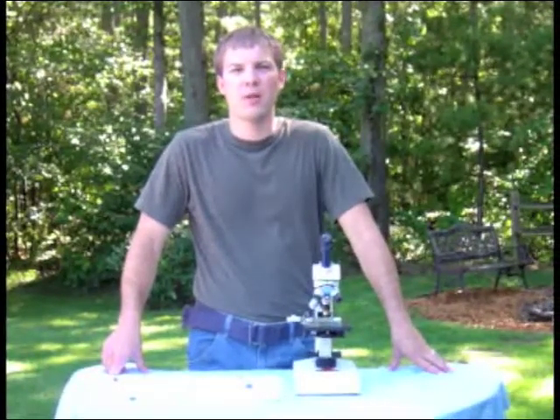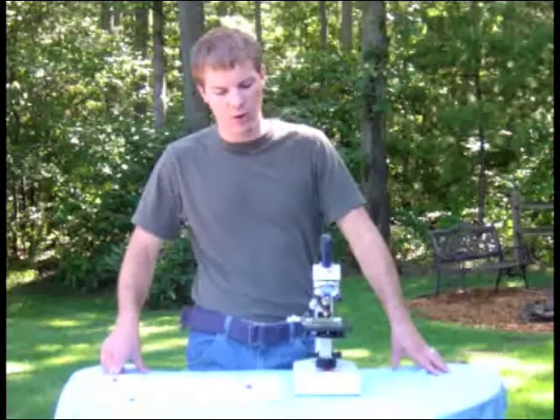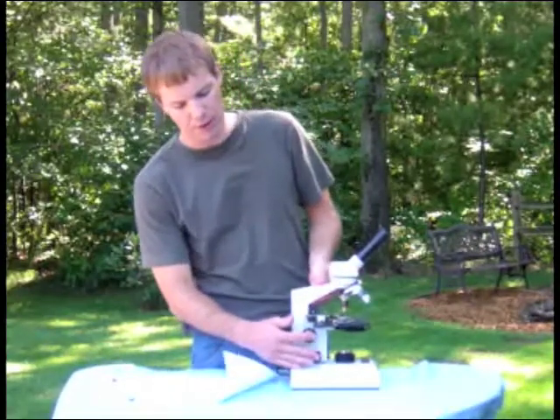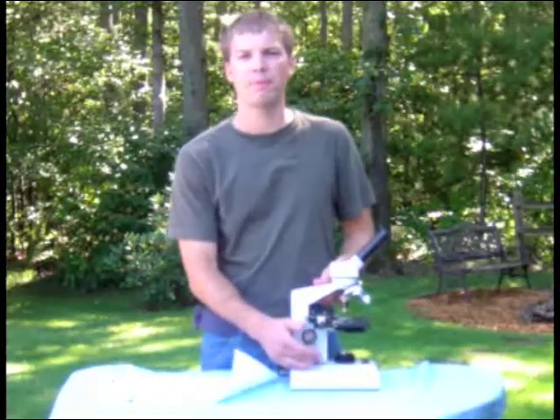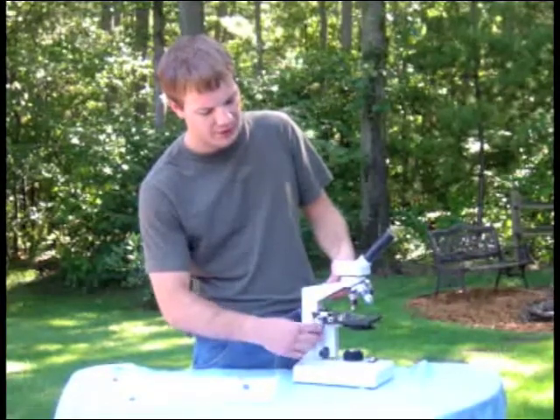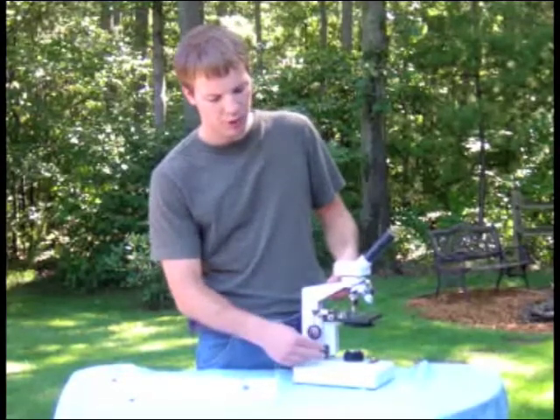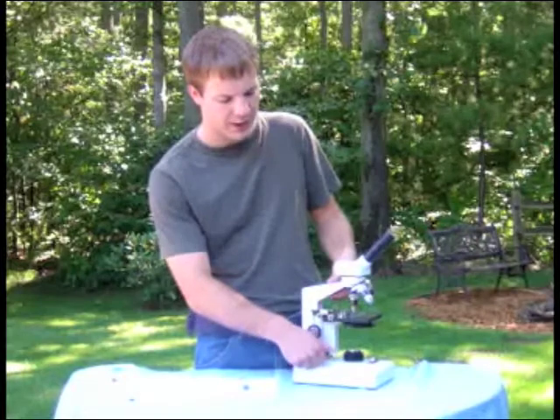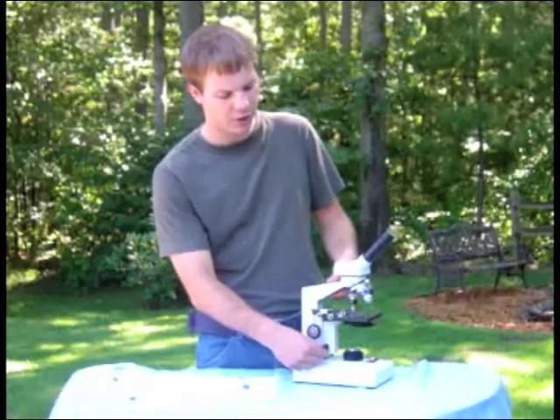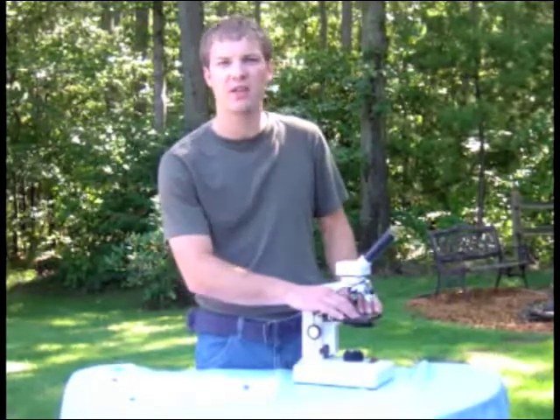When you use the microscope there are four things — four parts that you will want to be able to adjust. First, probably one of the most important things are the focus knobs, right here on the arm. There's a large one and a small one. The large knob is called the coarse adjustment knob — when you turn it, you can see the stage move up and down fairly quickly. Below that is the fine adjustment knob — when you twist it, the stage barely moves because it's moving very fine. These are the two knobs you'll use to bring your specimen into focus.